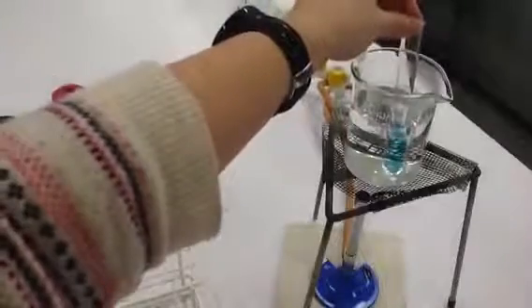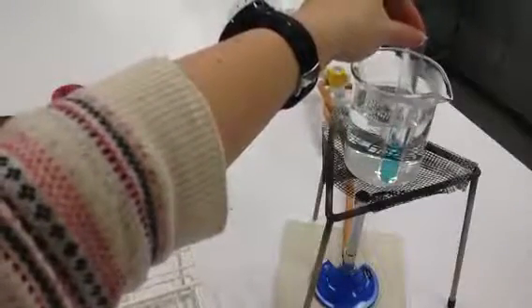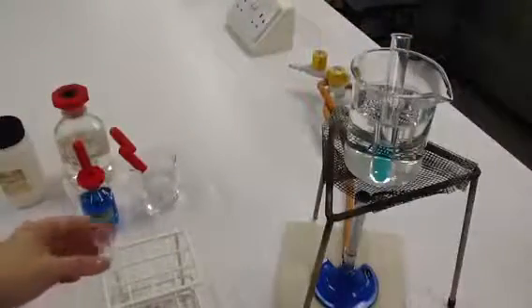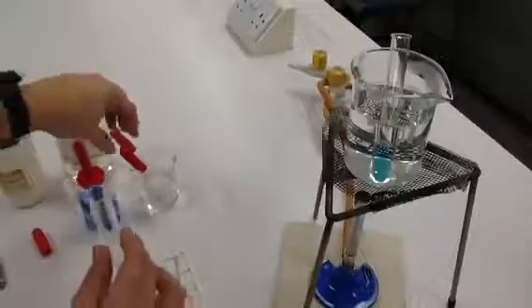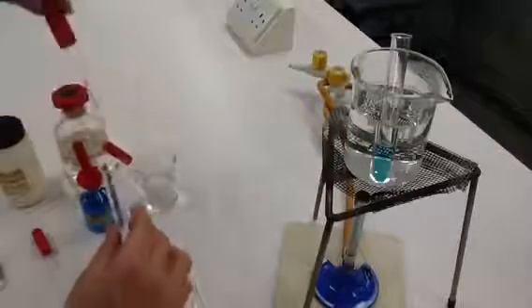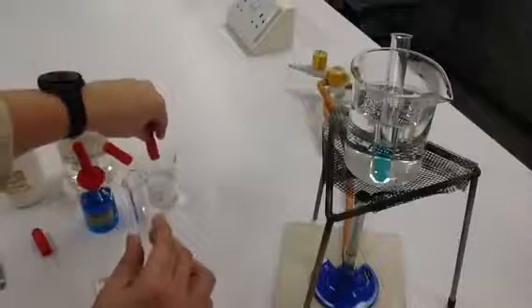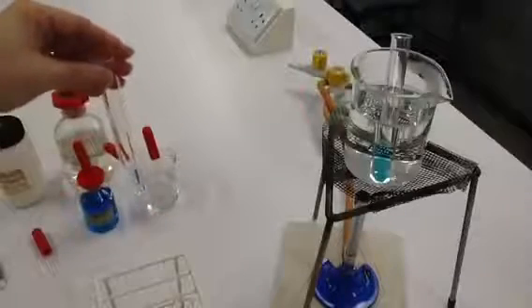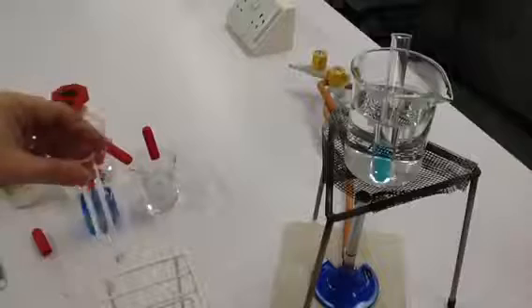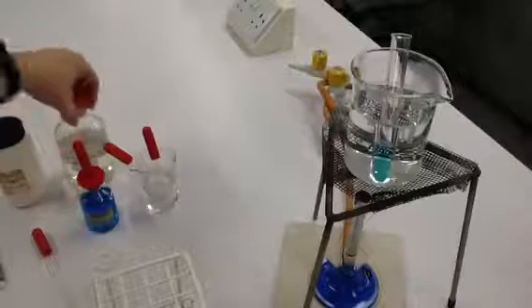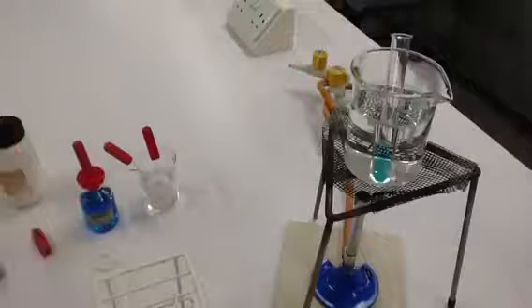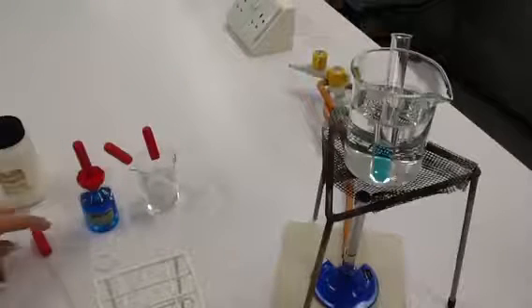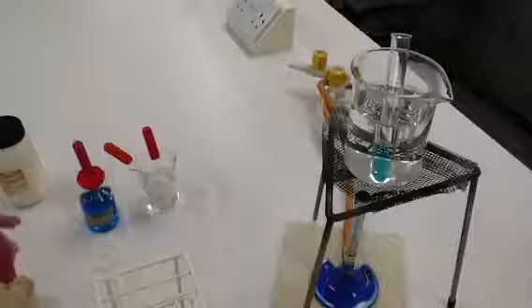Sample B, then, we need to continue to find out whether it's actually a non-reducing sugar instead. So it's really important that we discard this sample and we now take a new sample of our solution B, a fresh sample of B in our tube. The first thing we need to do this time is add some hydrochloric acid.